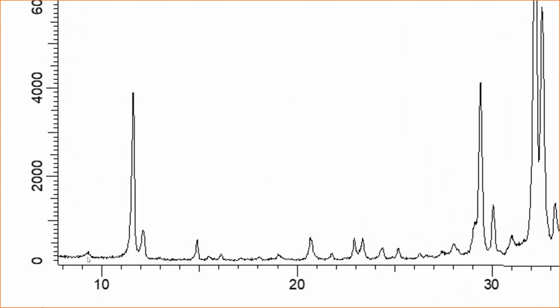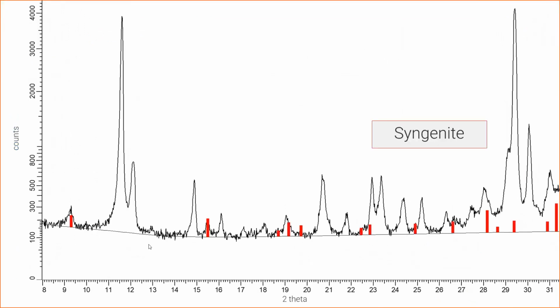So this is the main peak, syngenite. But there's some more information in the diagram. So once you have syngenite, you will not only recognize this looking here at the main peak at around 9 degrees 2 theta, there are also a couple of further pieces of information here in the diagram.